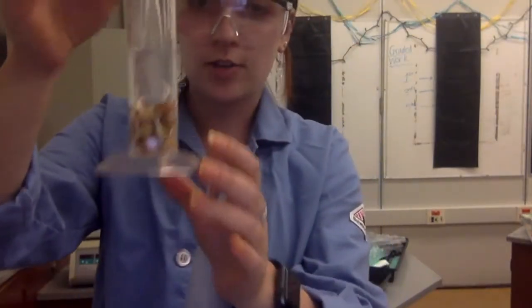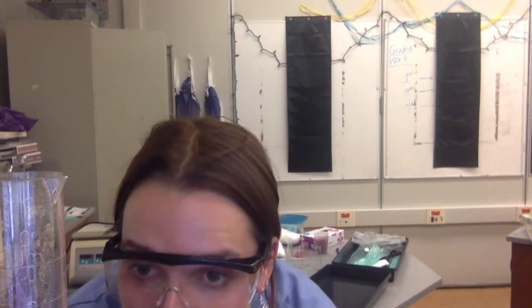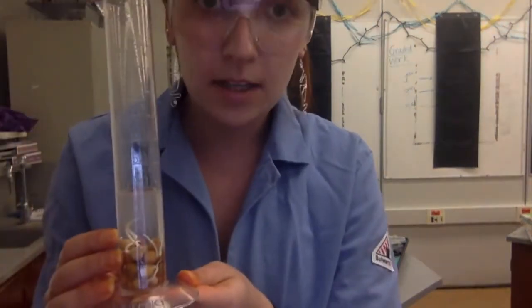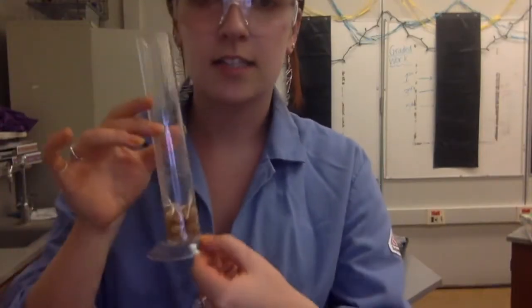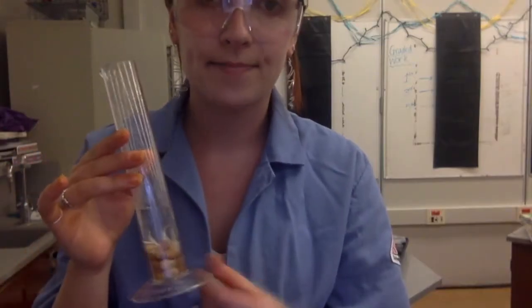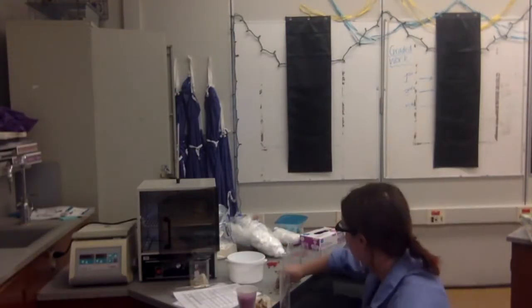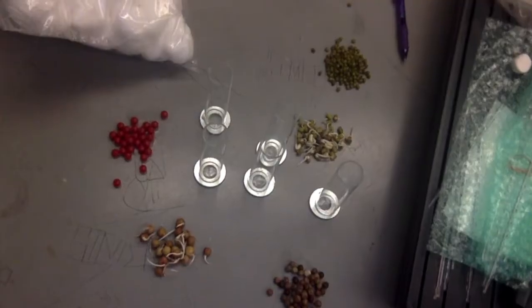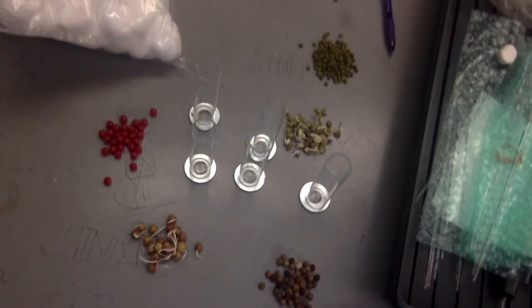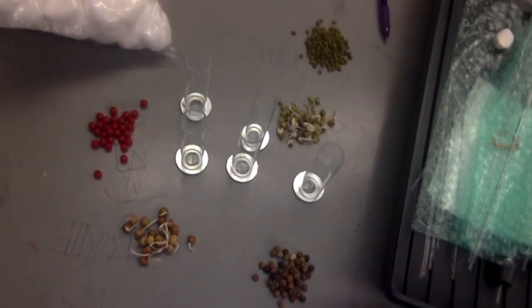Now if I measure this, it's up to 38 milliliters, so the peas take up eight milliliters of volume. I'm going to find eight milliliters of volume for all of my other experimental conditions — the beads, and germinating and non-germinating species of peas and mung beans — so that all conditions have equal volumes of eight milliliters.